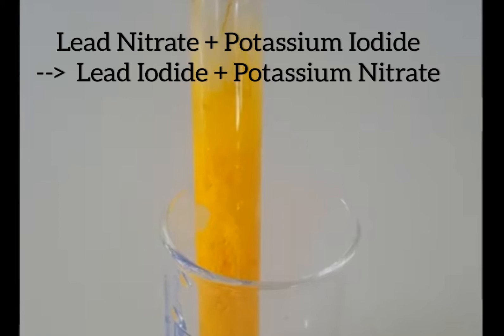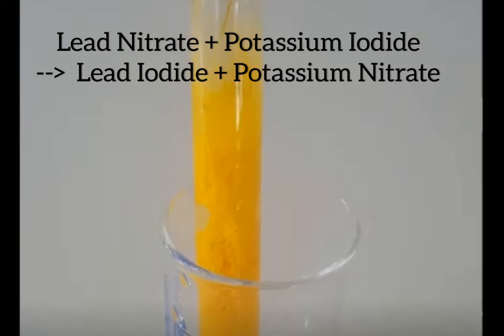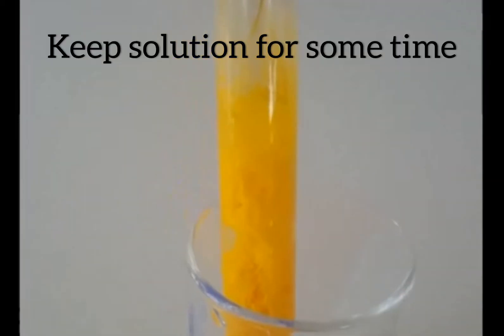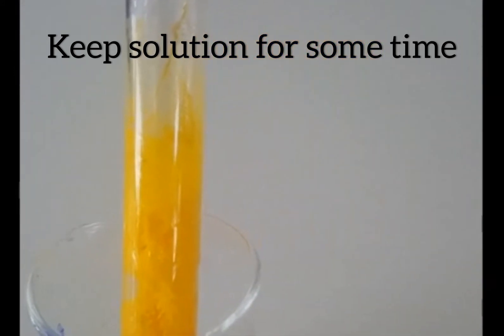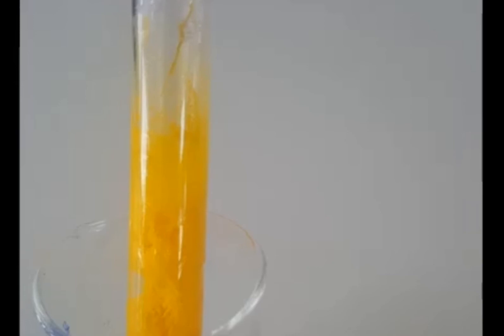The colorless solution is potassium nitrate and the yellow colored precipitate is lead iodide. I kept the solution for some time so that the yellow colored precipitate started settling down. After some time you can see a clear solution of potassium nitrate on top and a bright yellow colored precipitate settled at the bottom. This is after 10 minutes.